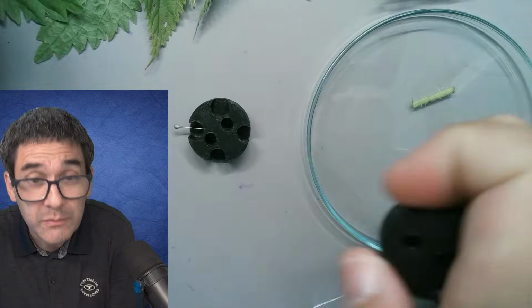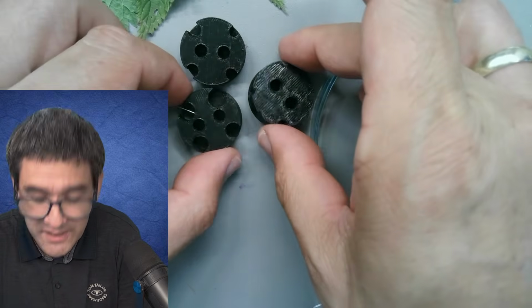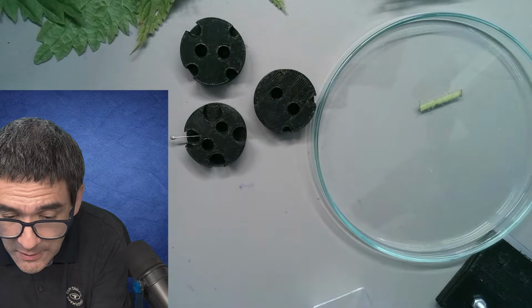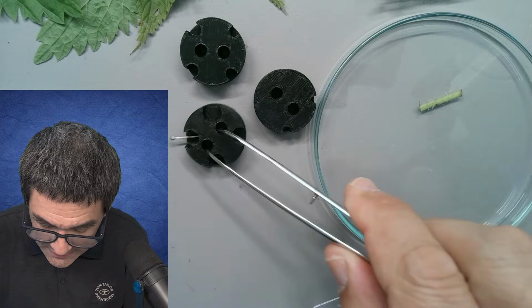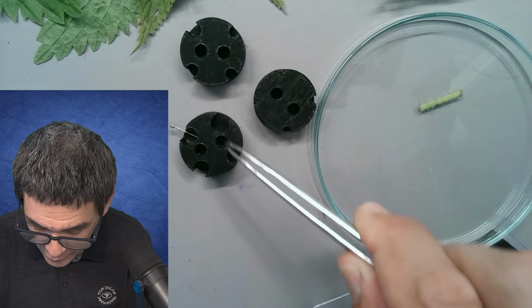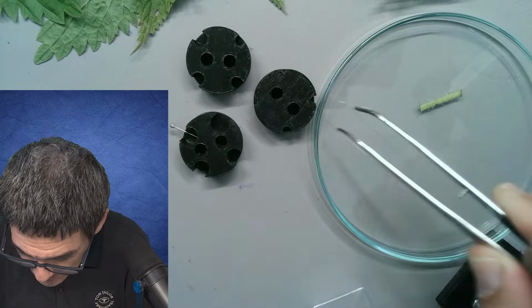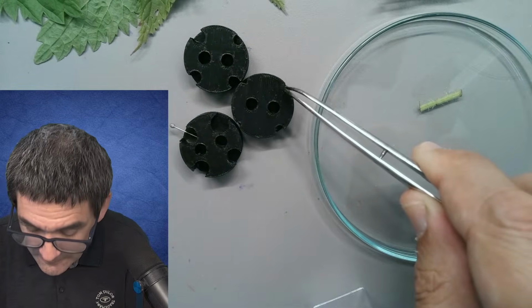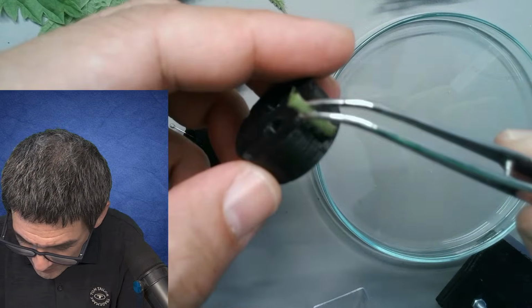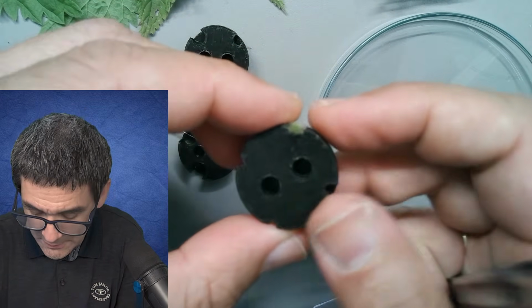If you've joined me already previously, you know that I have 3D printed several of these specimen holders. The two holes here in the center, for those of you who have not seen this yet, are simply for taking it out of the microtome. You're going to see in a second how this works. And I've got four different diameters for different stem sizes. I'll be using maybe this one over here, this one on the side. And I think this one might go in here. See, it fits without problem.